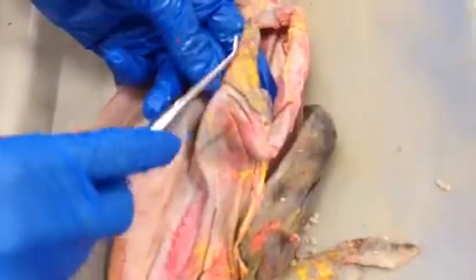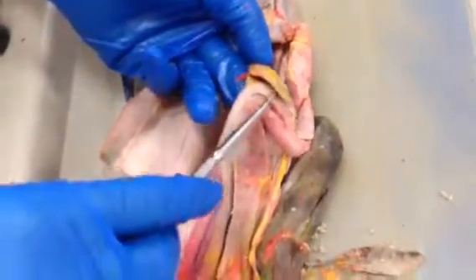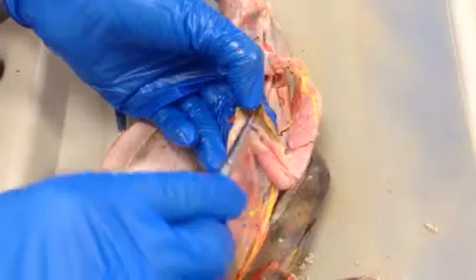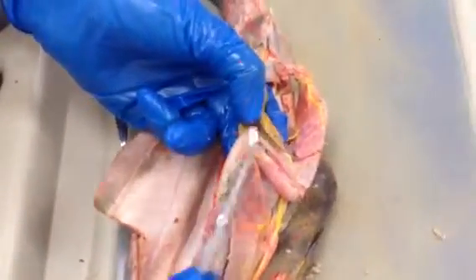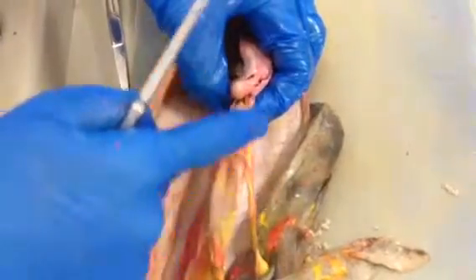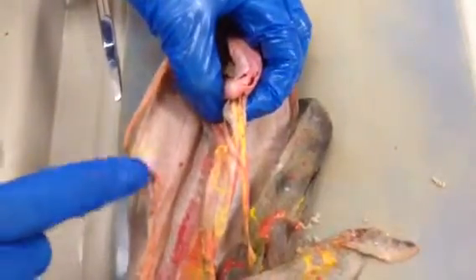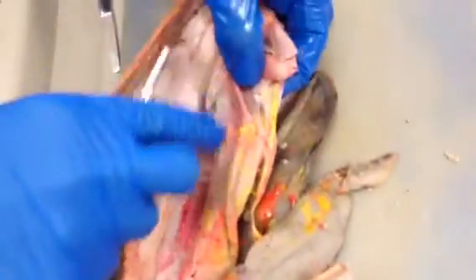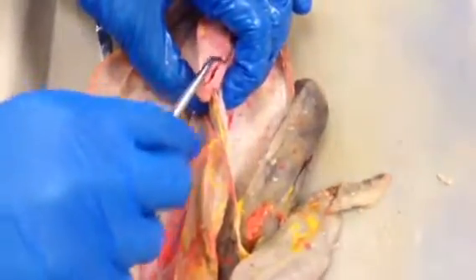The mesentery between the spleen and the stomach is called the gastrosplenic ligament. It's called a ligament because it's more like short and robust. So this mesentery right here is the gastrosplenic ligament. Gastro just refers to the stomach here. Okay. Another important mesentery here is the lesser omentum. So this mesentery here that surrounds this complex of arteries and veins is called the lesser omentum. It's also known as the gastrohepatoduodenal ligament. The hepato part refers to the liver, hepato or hepatic. The gastro part refers to the stomach, and the duodenal part refers to the duodenum here.